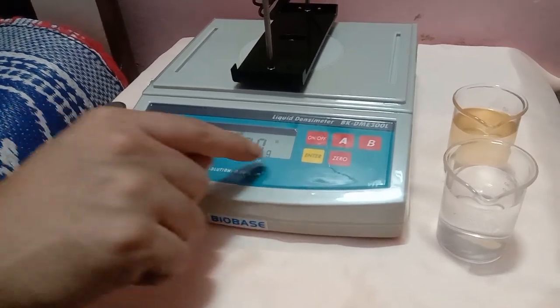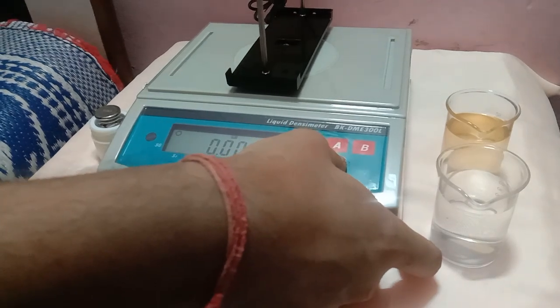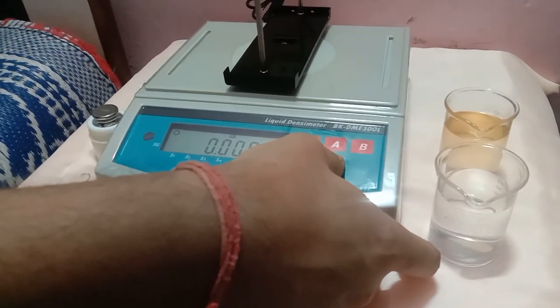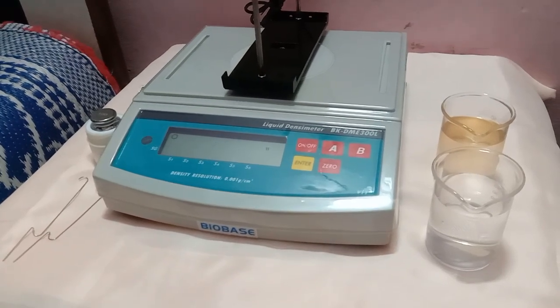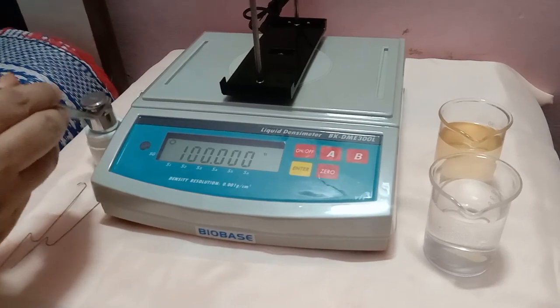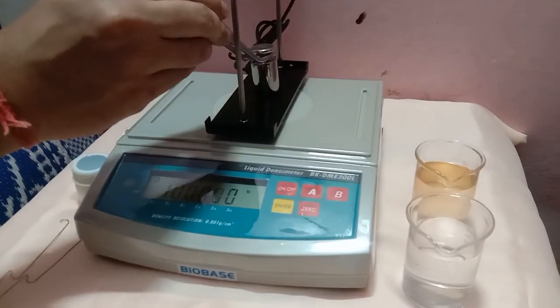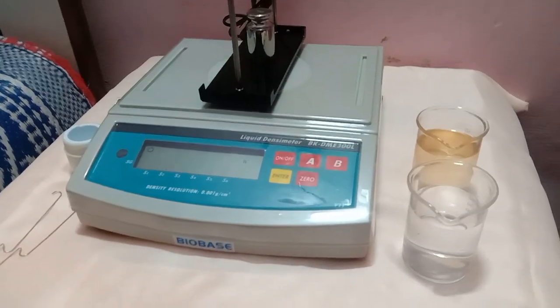Once you get this value, let's do the calibration. Long press the 0 button until you get Cal 0. Once you get Cal 0, it will ask you to put the 100 gram weight.